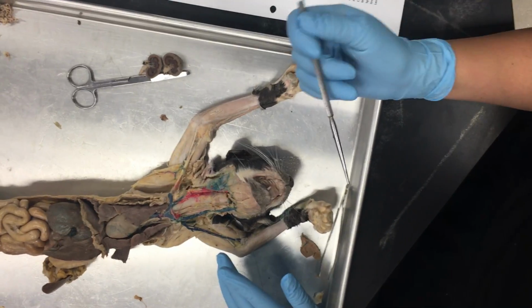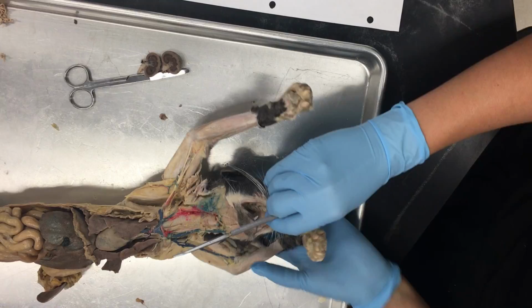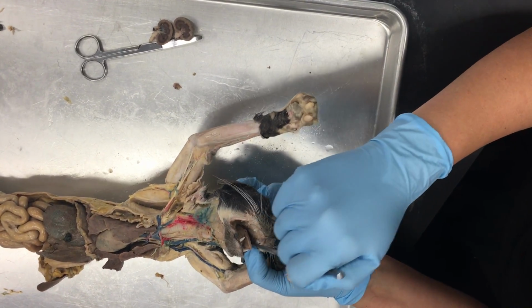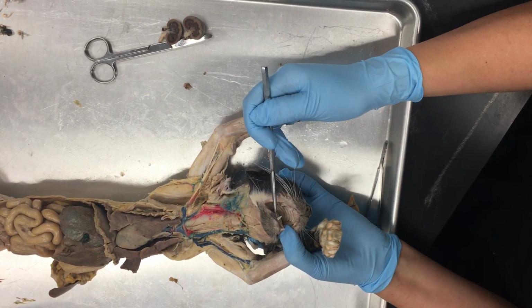So for the cat organs, we're just going to go down the list to make sure we're seeing everything, starting with our digestive system. First bit's the oral cavity, literally just the opening in the mouth, all of this open space here. Then on the roof of the mouth, we have the palate. There's two regions to the palate.